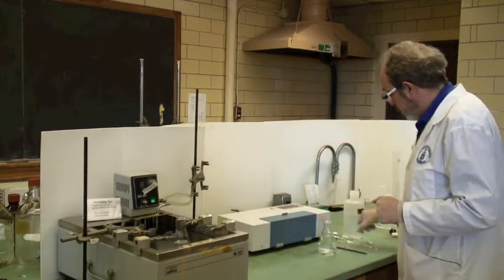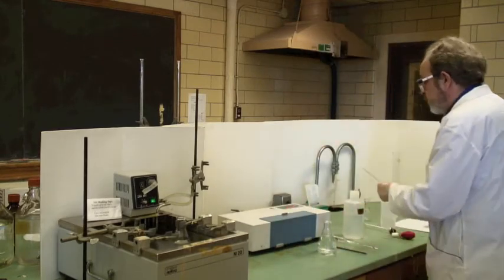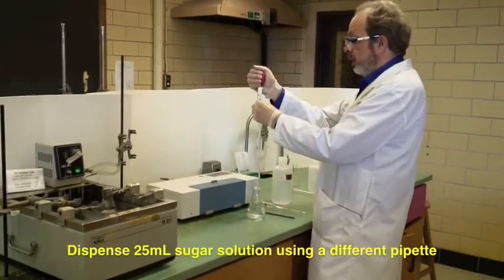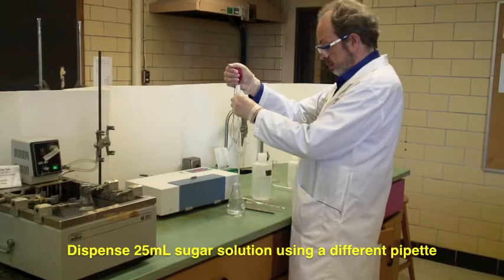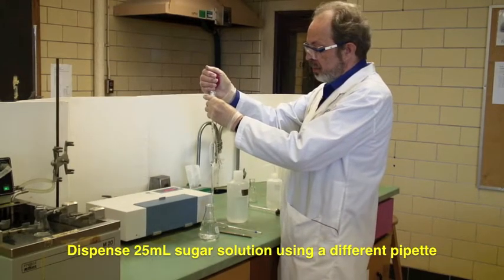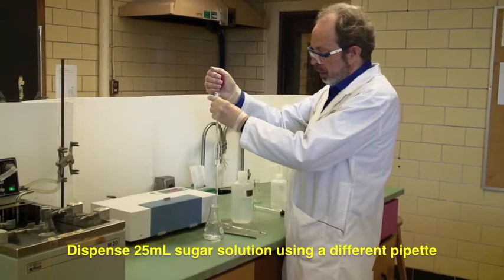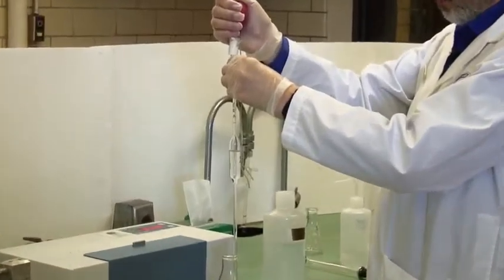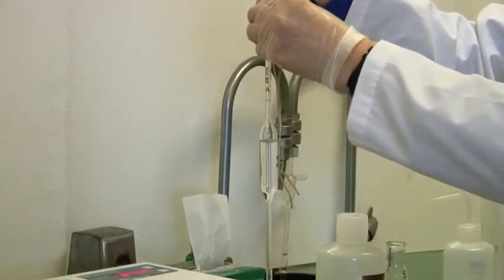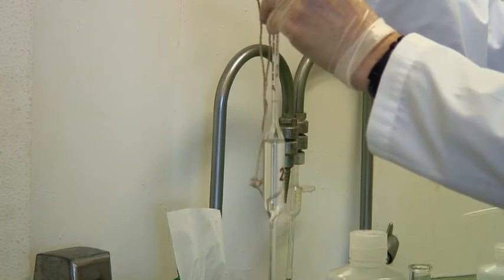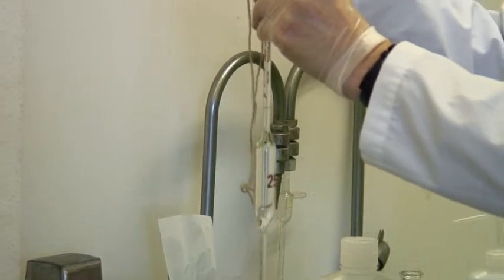Meanwhile back at the sugar. I think we've got this ready to go. It's all dissolved and I'm taking my clean dry pipette. I'll take the sugar solution or syrup and fill it up.